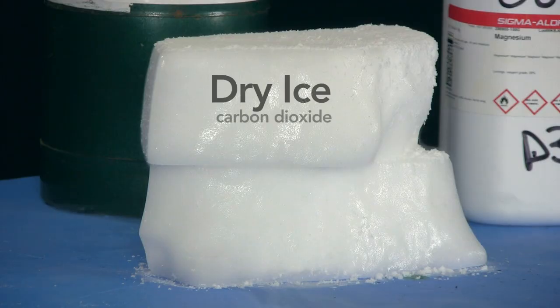As we did with water, so we can with carbon dioxide, take the two parts asunder. The simplest and quickest way is to act upon the carbon dioxide by a substance that can attract the oxygen from it and leave the carbon behind. You recollect that I took potassium and put it upon water or ice, and you saw that it could take the oxygen from the hydrogen. Now, suppose we do something of the same kind here with this carbon dioxide.